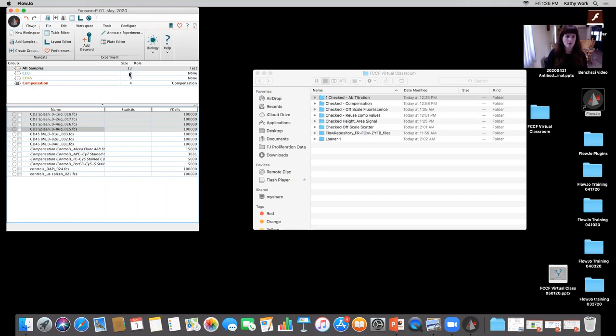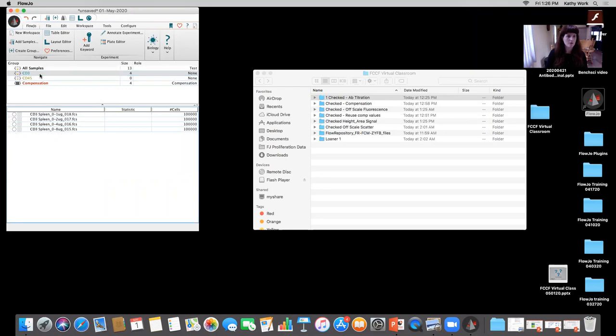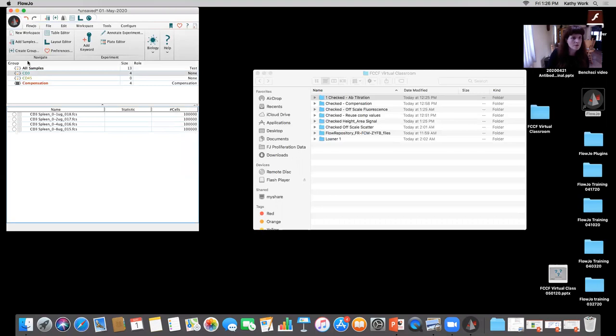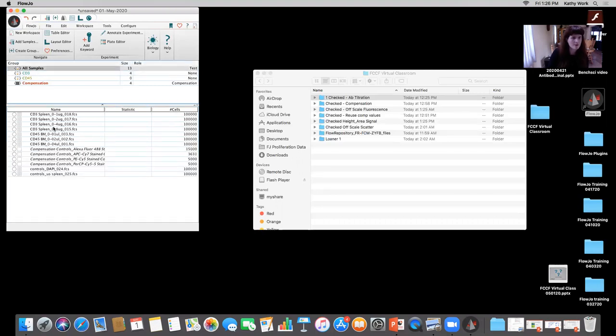You can see now it has four samples there. I can also add the unstained there as well, for a nice reference, drag in. Did not go in. Okay, well, I'll have to take a look at that.